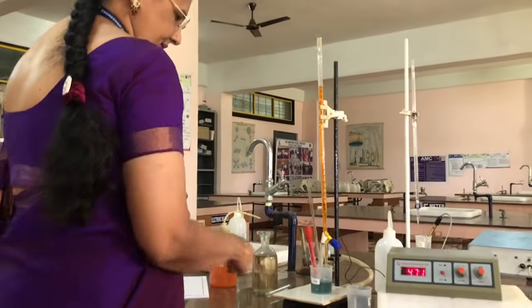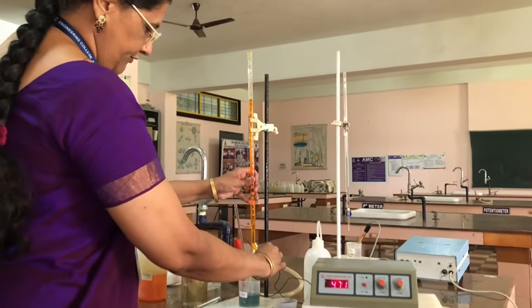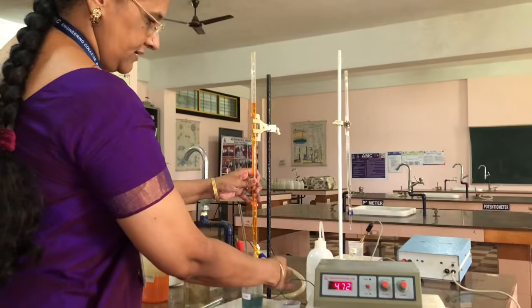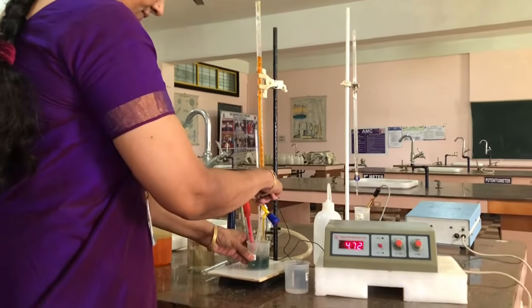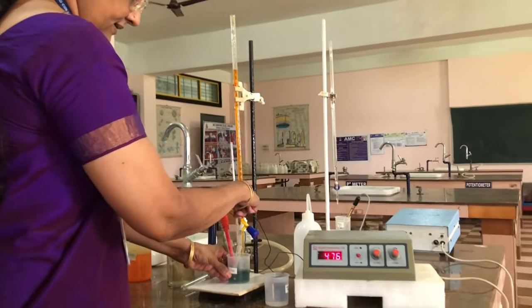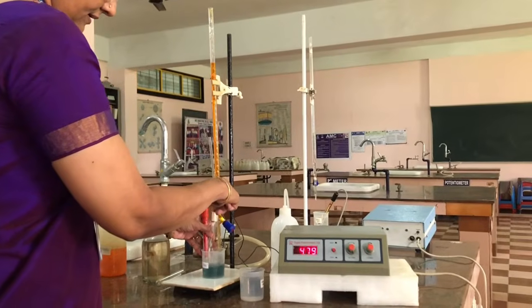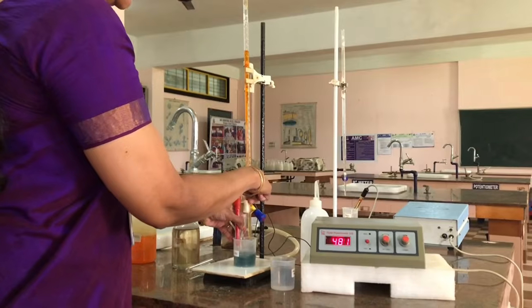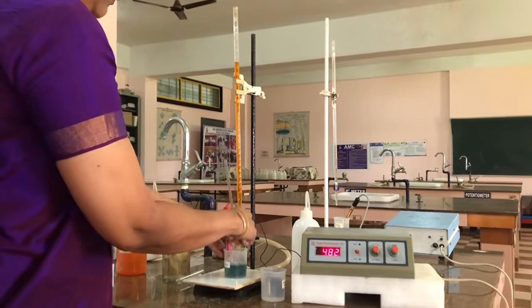It is increasing. 3.5 to 4 I am adding. Again shaking. Now the EMF of the solution is 481.